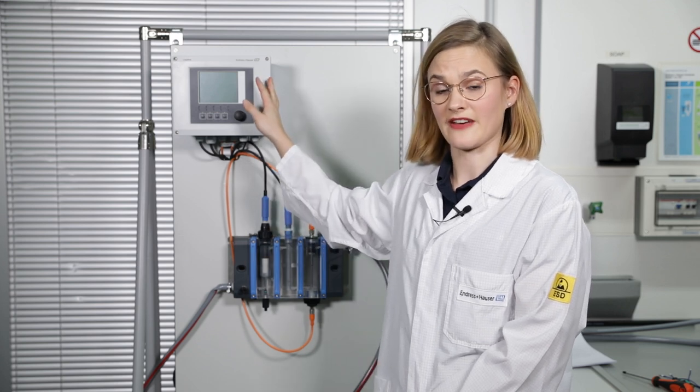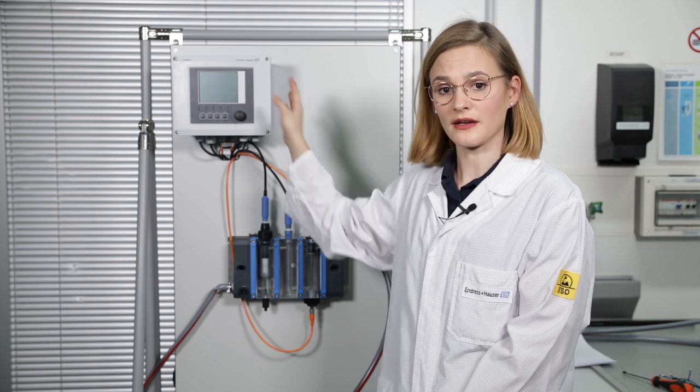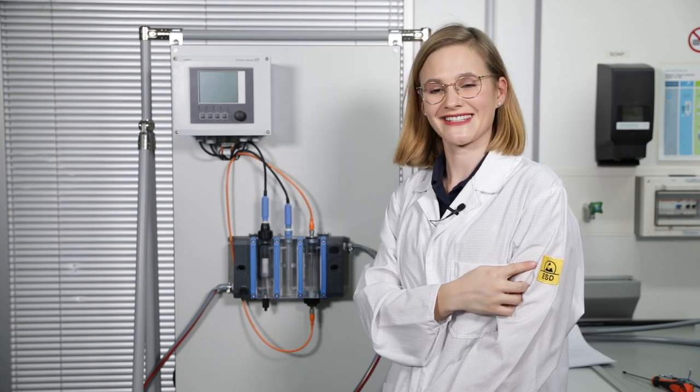Before you start with the wiring inside the transmitter, make sure that the device is unplugged and that there is no voltage on any cable. And assure that you are working according to the ESD guidelines.